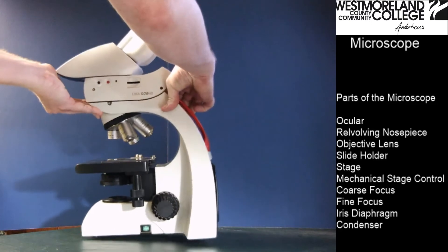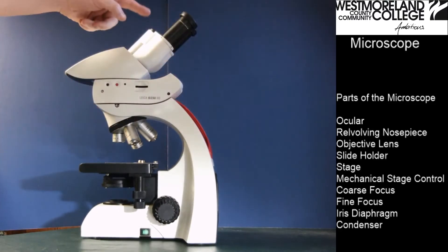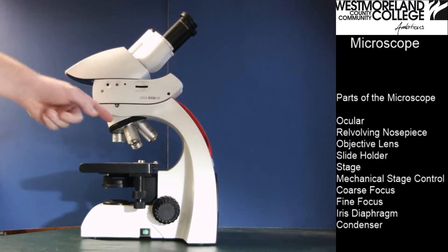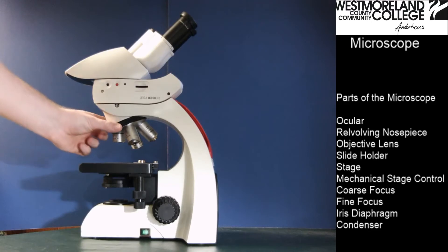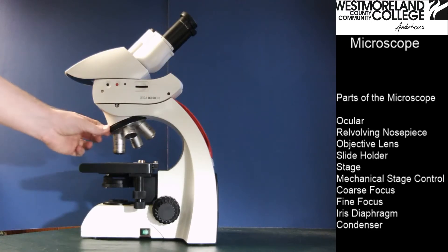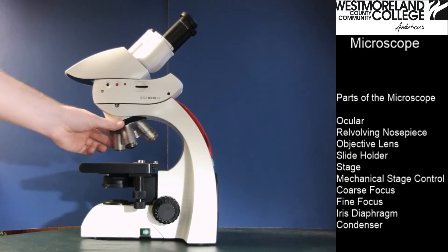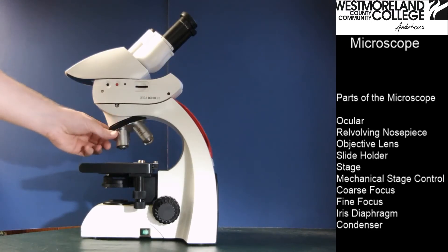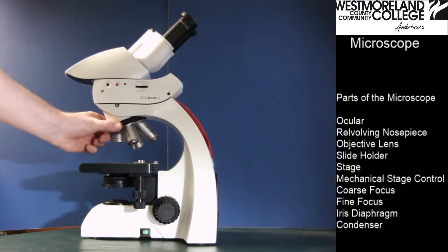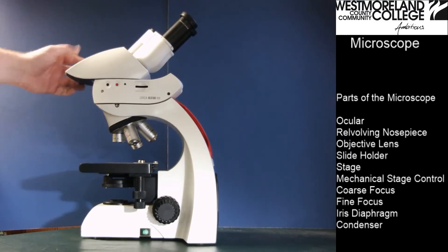Turning to this side, you can still see the oculars. Moving down, you can see the rotating or revolving nosepiece, which holds the four objective lenses on this microscope.